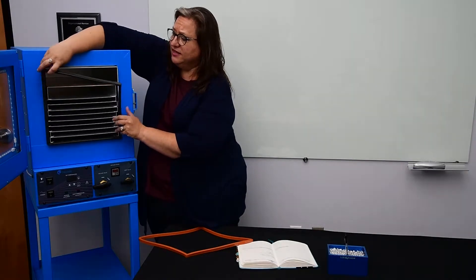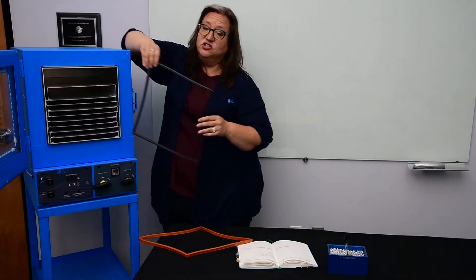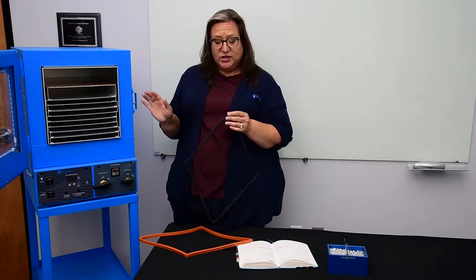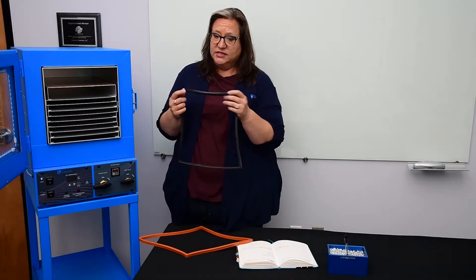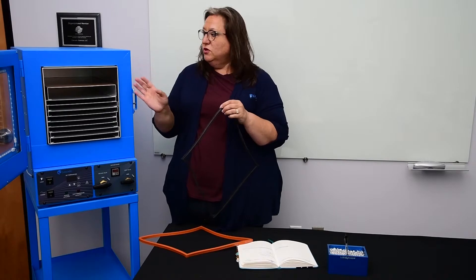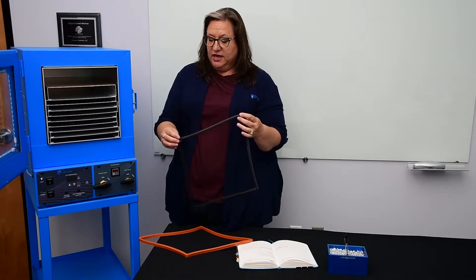When you inspect your gasket you're going to want to remove it from the oven when it's absolutely cold. It is essential — never, ever, even if you think there's a problem — don't remove a warm gasket. It's going to stretch out of shape, and it's like trying to put toothpaste back in the tube — you're never going to fix it. Once you've pulled a warm gasket off and it's stretched out of shape, that's a hundred dollar mistake you'll never make again.